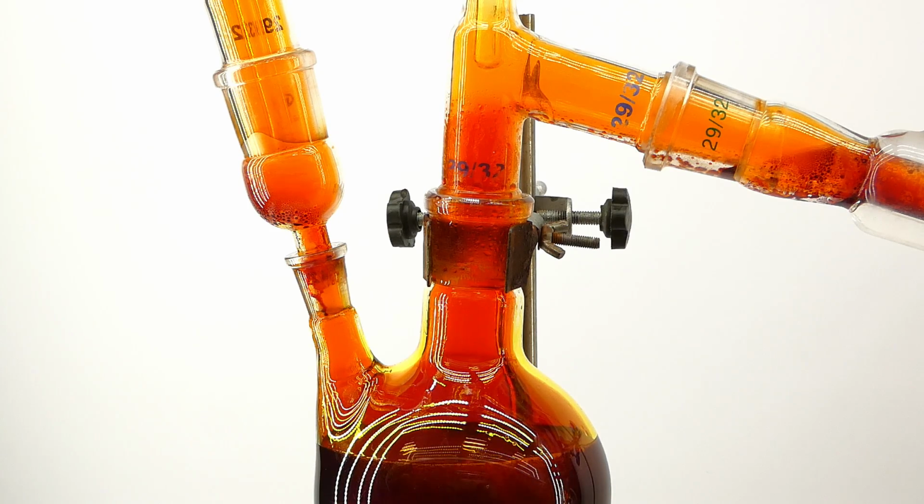Okay, and now it's time to explain the reactions going on here, and honestly, I couldn't find any good info about some of them, but I will try to explain everything as best as I can, so that you can get a hold of the overall process.